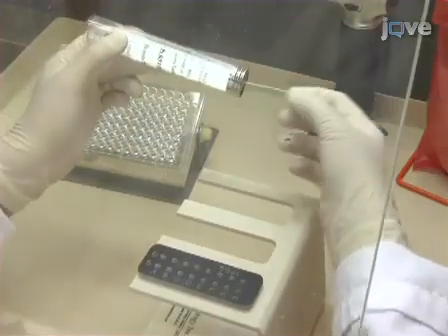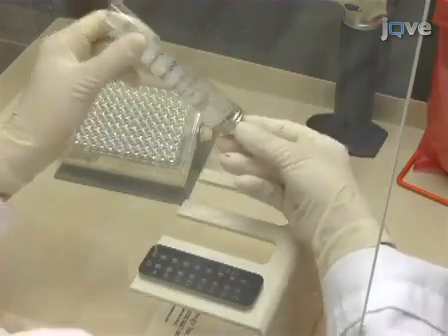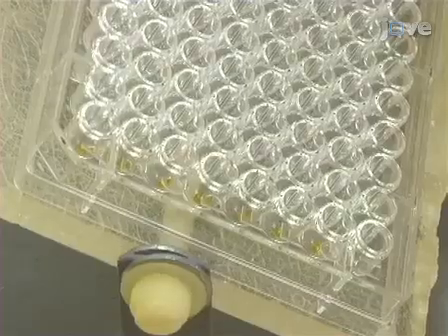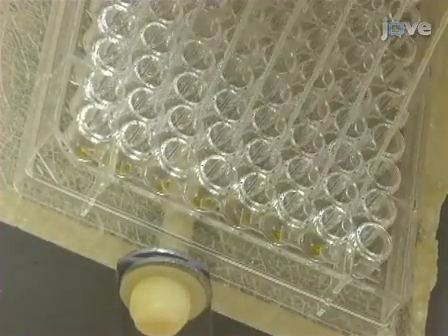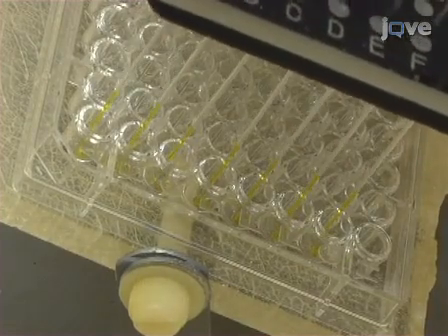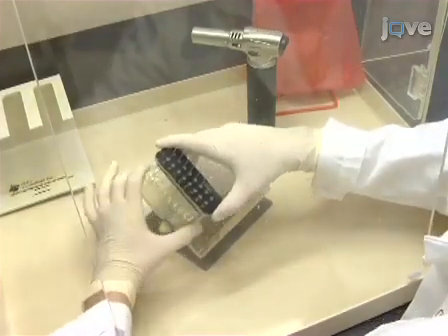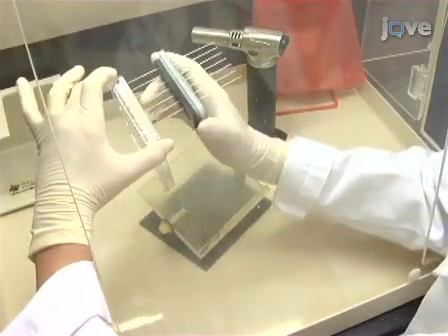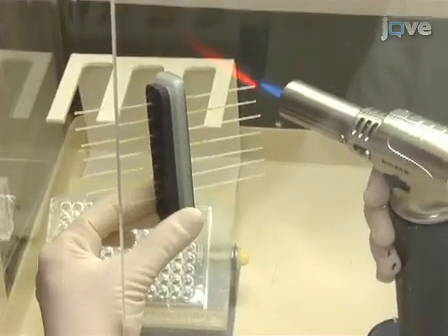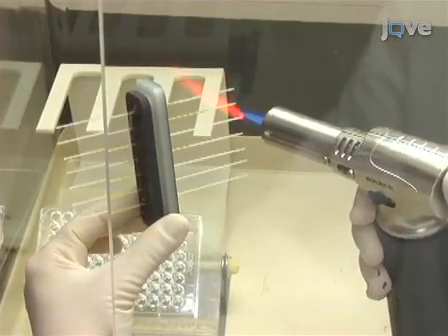Next, place 10 microliter capacity glass capillaries into designated holders for the Idaho Technology Rapid Cycler. Once secured in the holder, load each glass capillary with the PCR reaction mix by touching the capillaries to the bottom of the wells. Tilt the holder to allow liquid to move down the tube and provide space between the ends and the PCR mix before heat sealing the glass tubes with a butane torch to seal both ends of the capillaries.